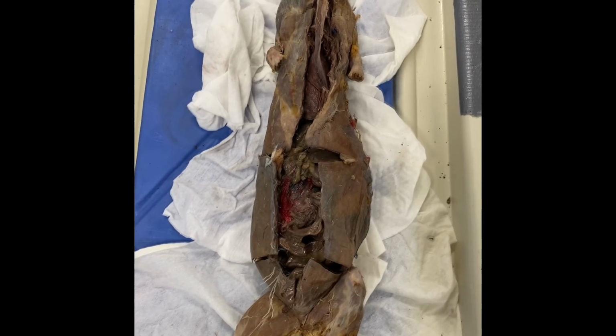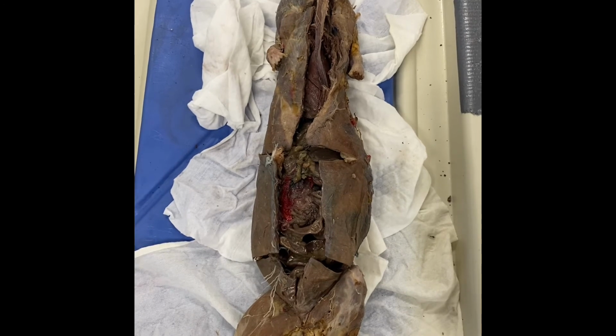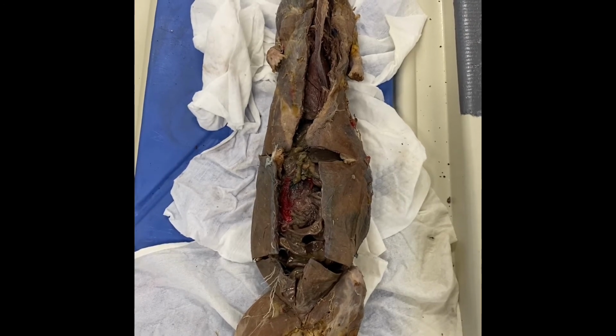The mesentery is not a tissue, it is an organ located around the intestines that also stores fat, but also supplies blood and nerves to the intestines. The common bile duct is what carries the bile from the gallbladder to the small intestine. The accessory organs of the digestive system are the salivary glands, the liver, the gallbladder, and the pancreas. They're called accessory organs because they do not actually partake in the digestive process.